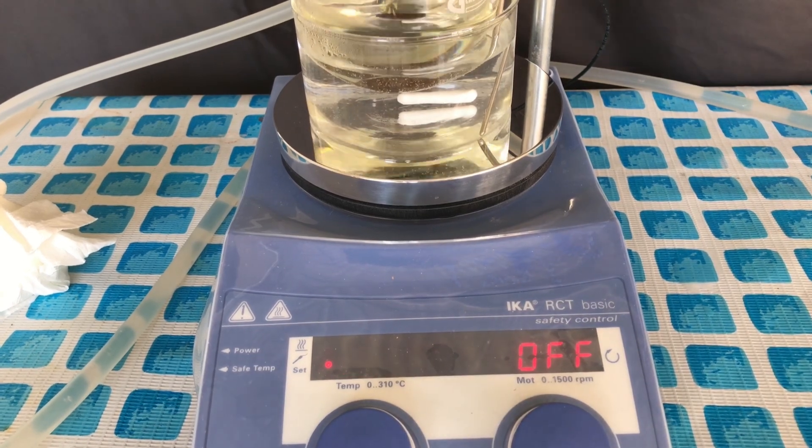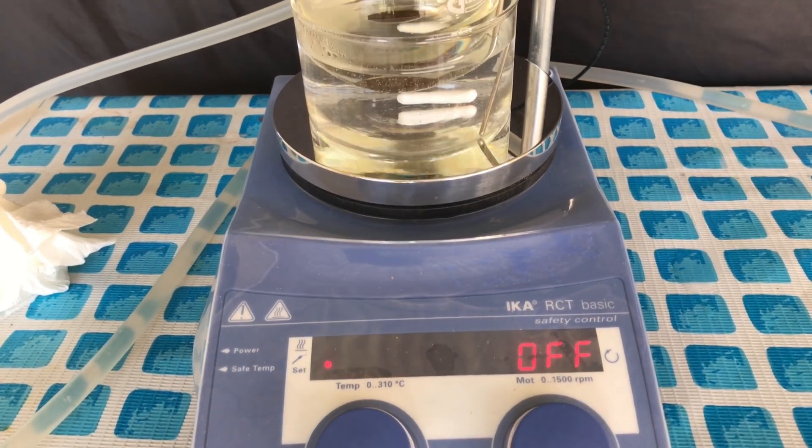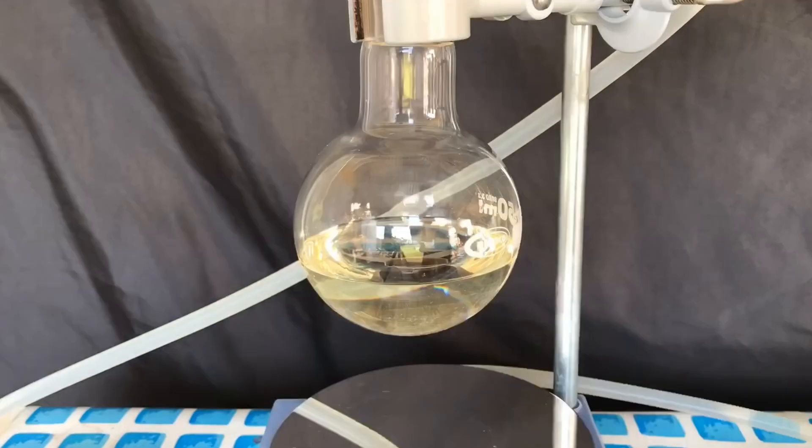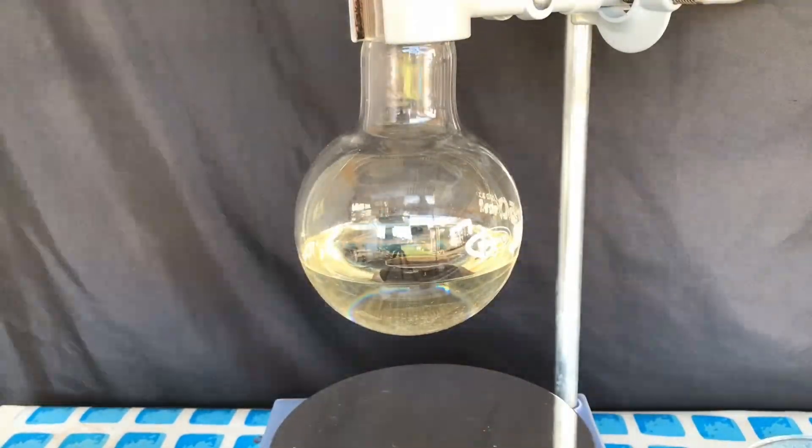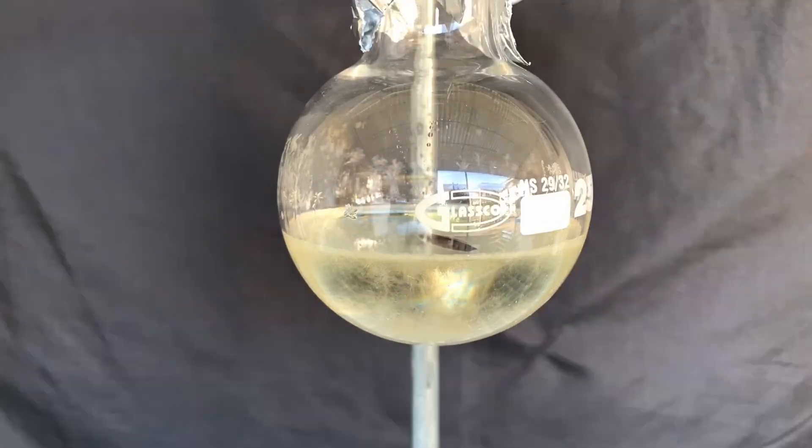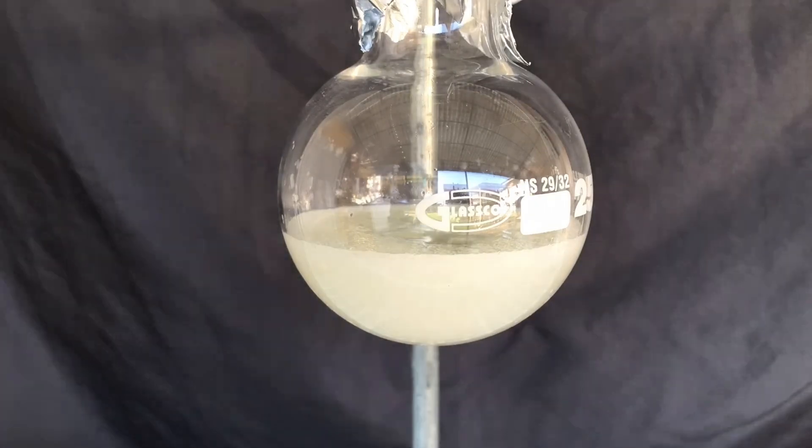It turns out that the product itself has a melting point of about 72 degrees C, which means that it's liquid at the temperature of the water bath that we used. It took some time and it didn't want to solidify at first, but I shook it a little bit and it crystallized.